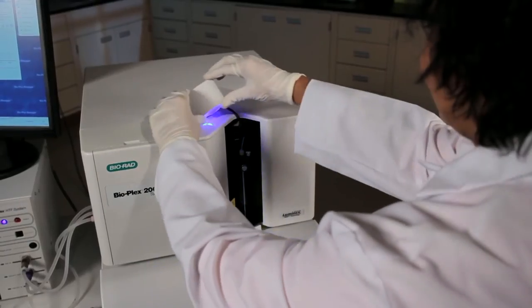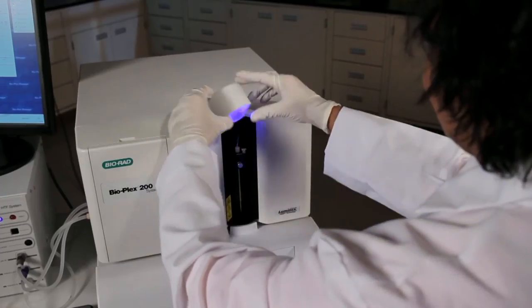To release the tubing, remove the light housing, free the tubing, and replace the light housing, making sure the tubing behind it is kept free.